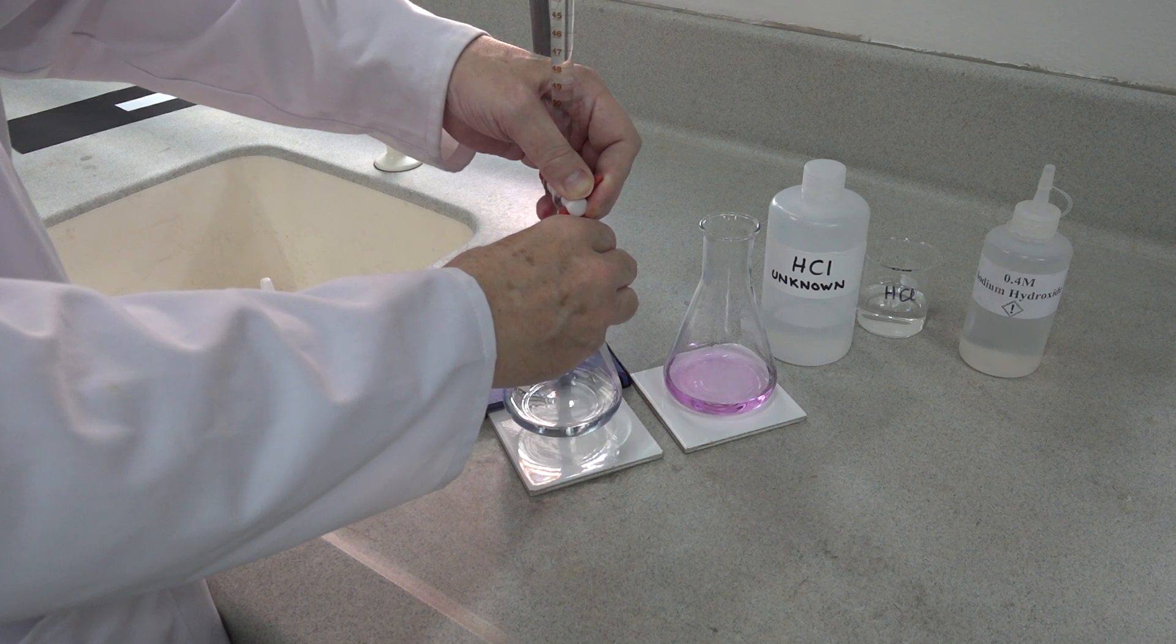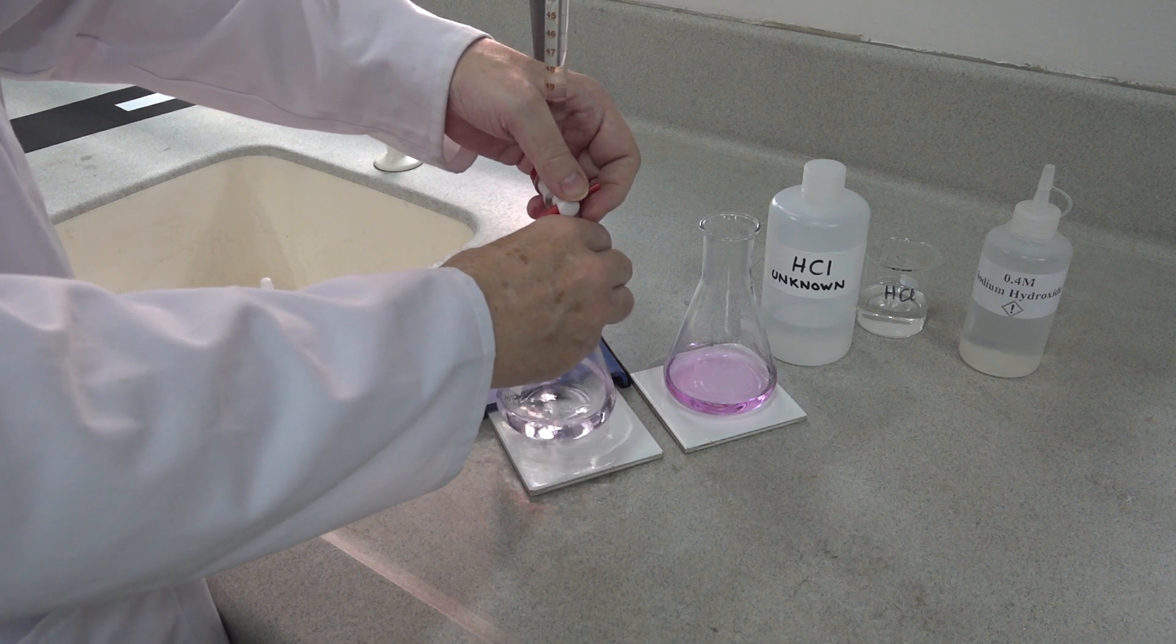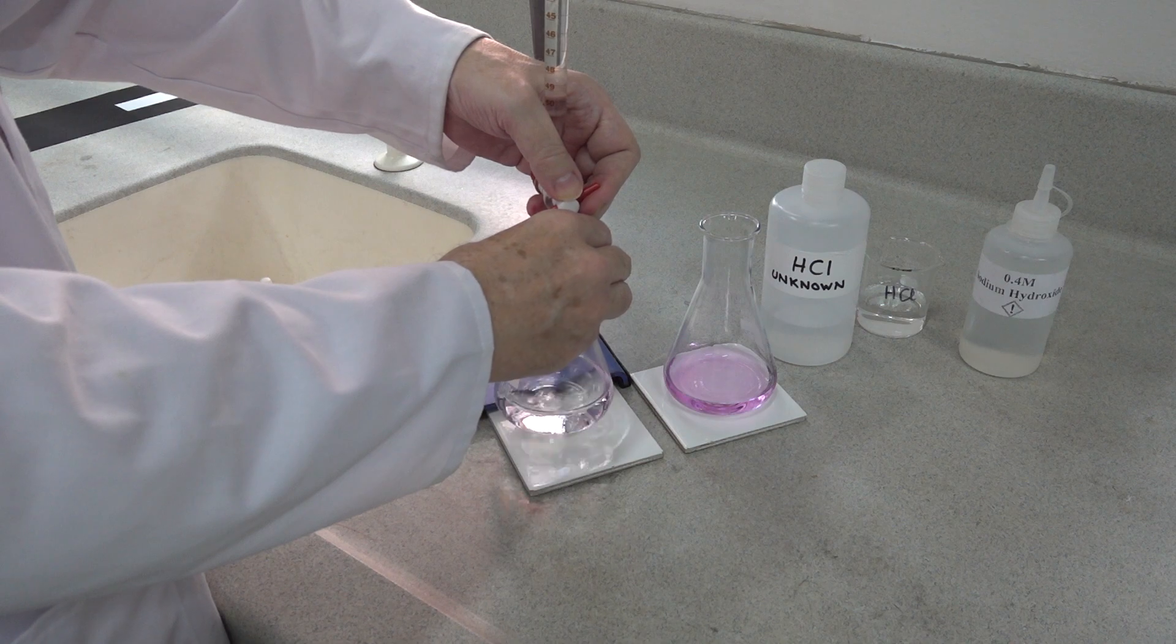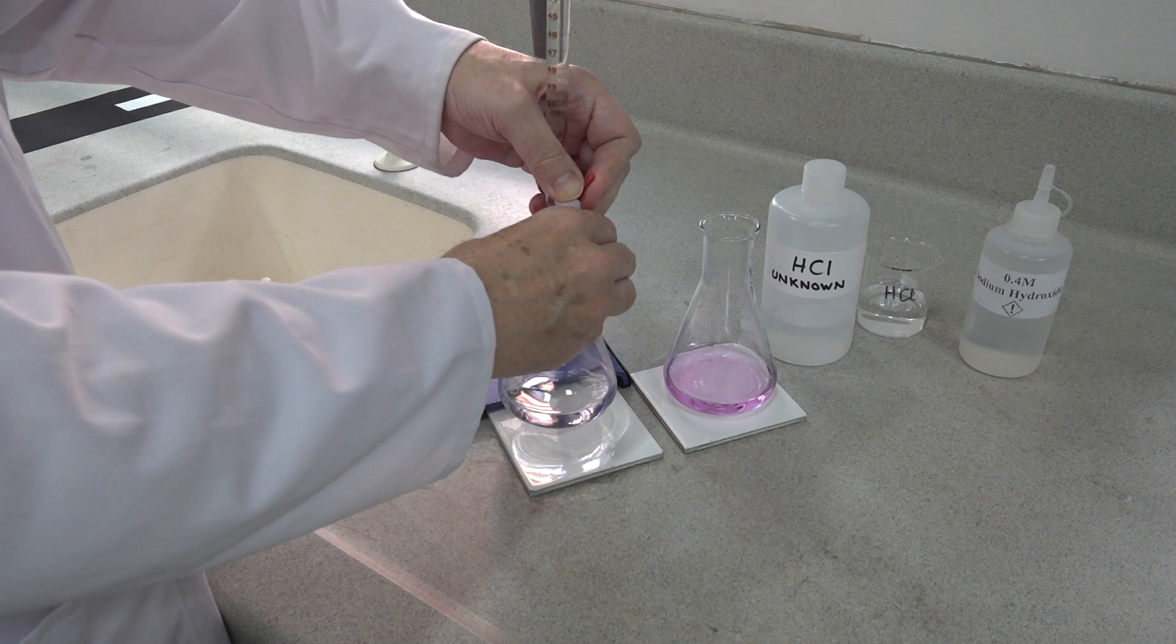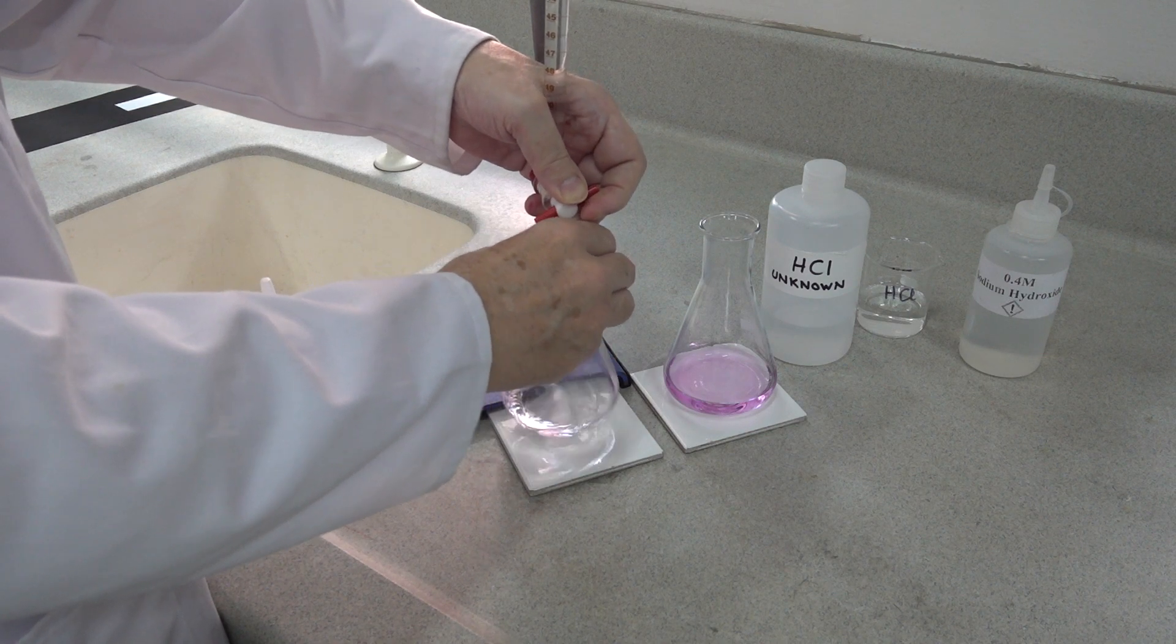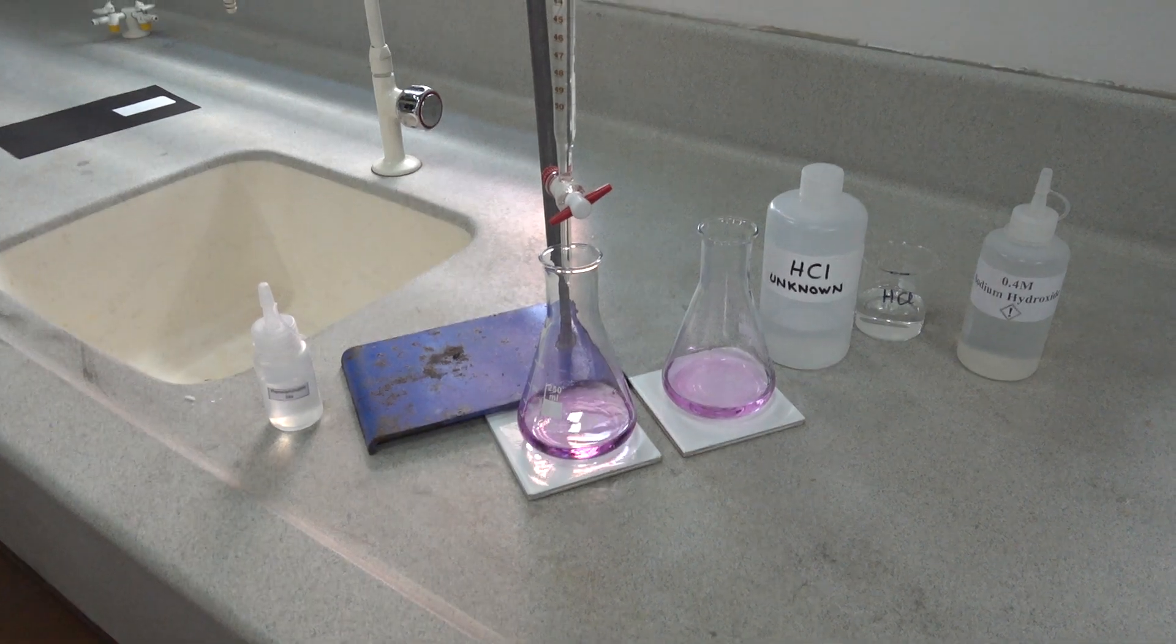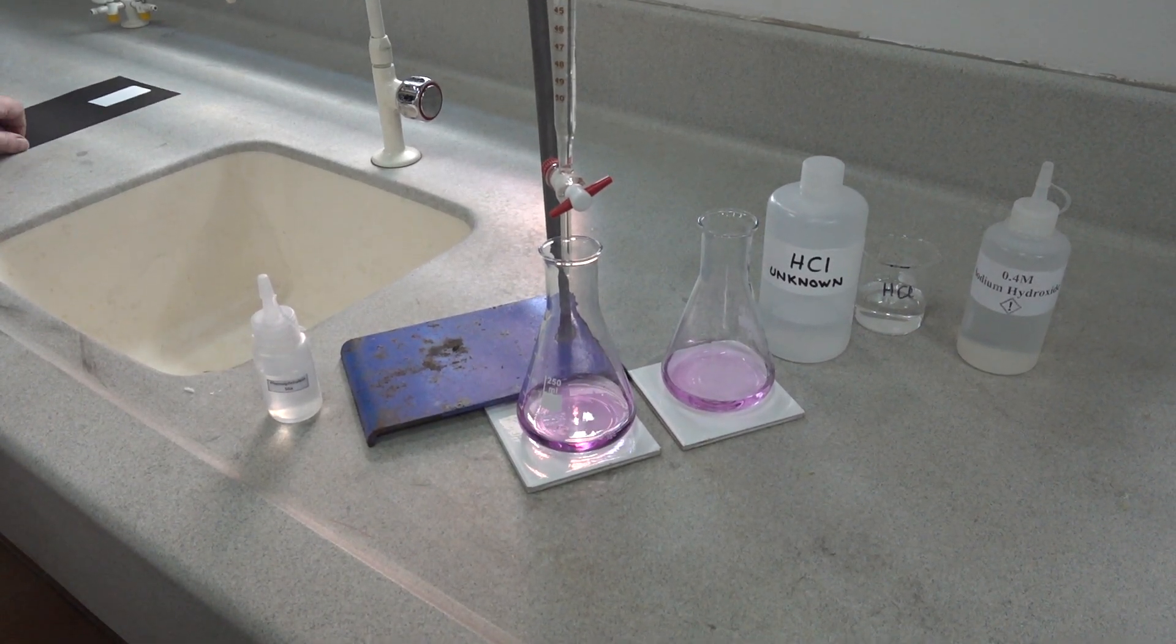We need to add another drop. Not quite. One more drop. And now, on the addition of one drop, we get our pink coloration. We need to take our second reading.